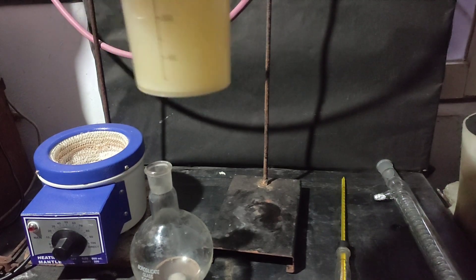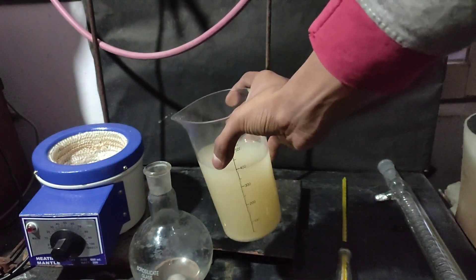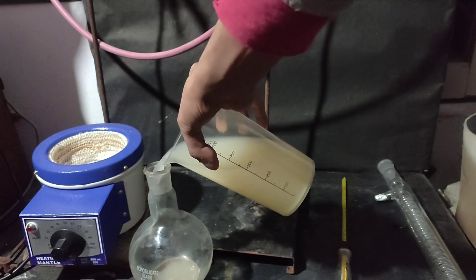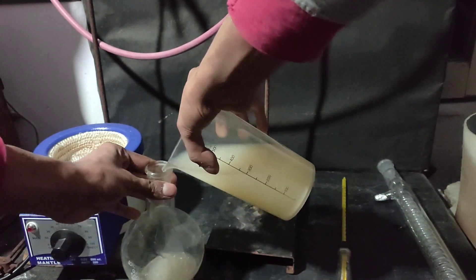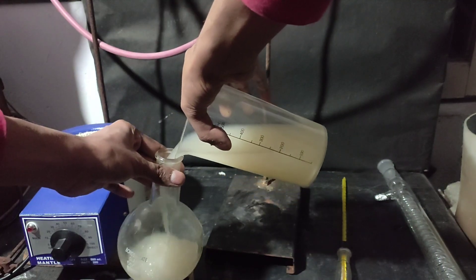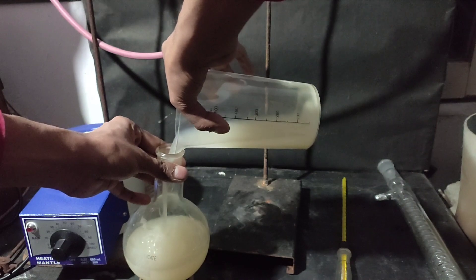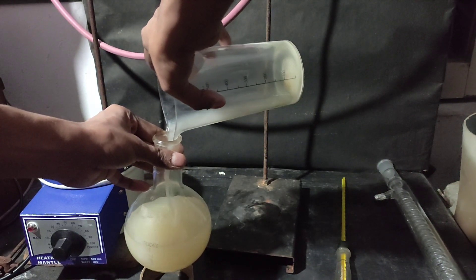So it must be 95.6% which means that our DIY column passed the test with full marks. But the only limitation of my DIY column is that it can't be used to distill acidic solutions as acid would attack steel.